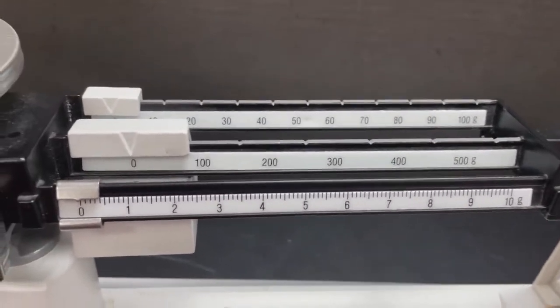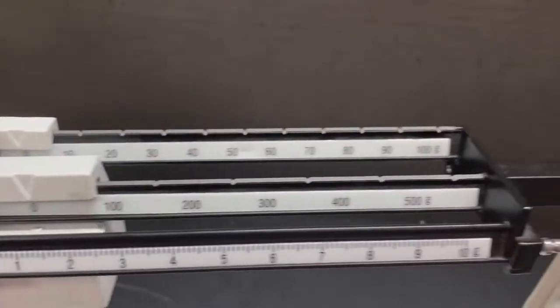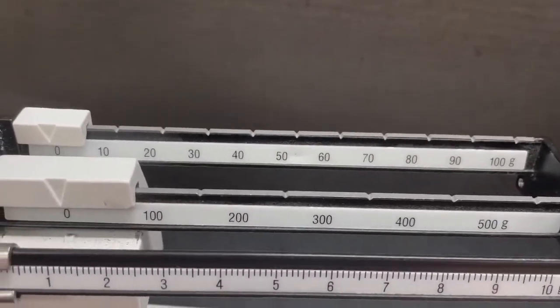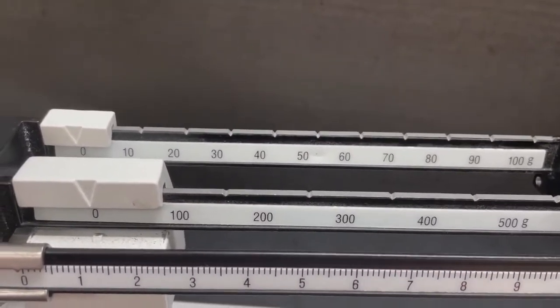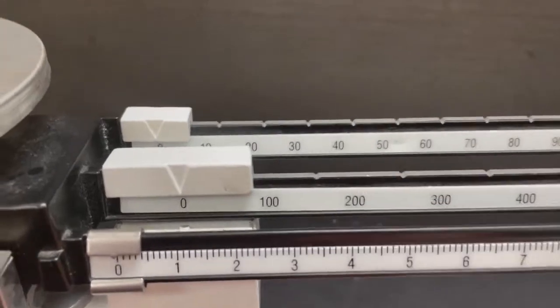You want to use the heaviest weight first. We have three beams. The first beam is a single gram weight. The second beam, or the middle beam, is a 100 gram weight. The last one back in the back is a 10 gram weight. You always want to start with the heaviest.